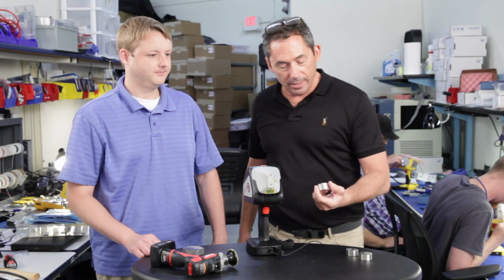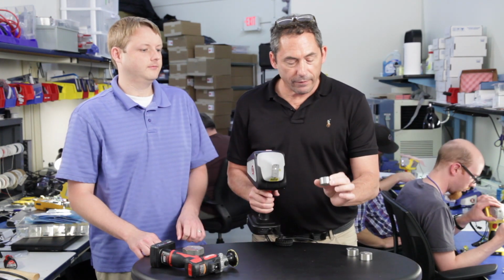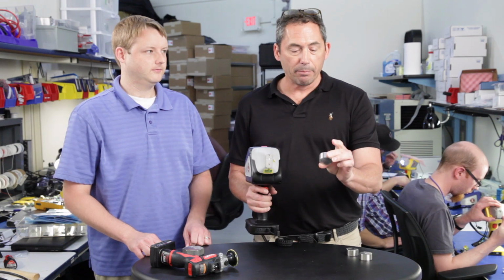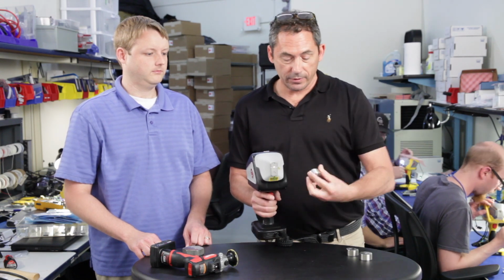All right, so here's what we've done. Let's take a 304. We've now made it so there's an automatic pre-flush and pre-burn that's user settable but fixed at about a second or so.